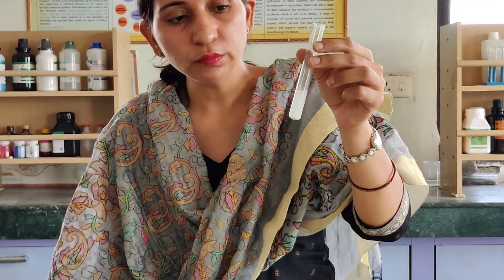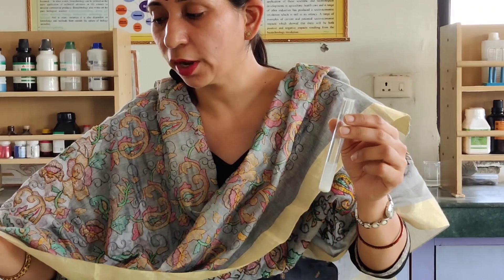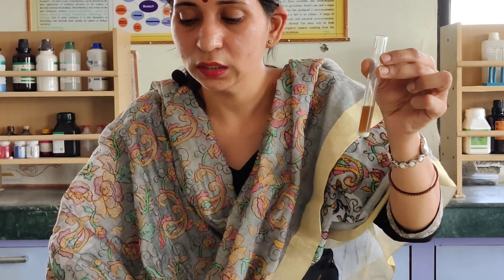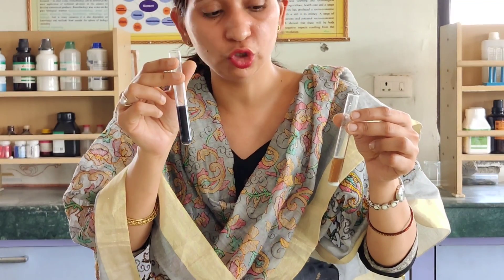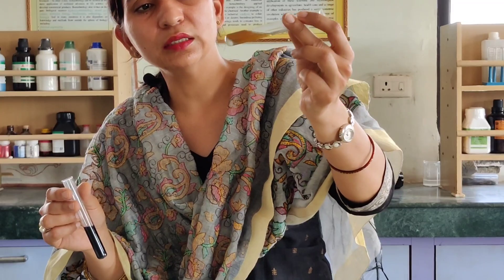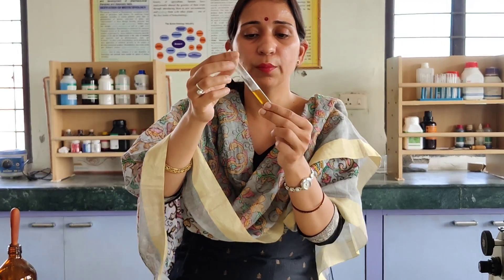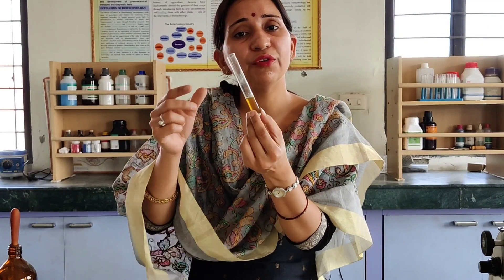After some time, we add a few drops of iodine solution to check for the presence of starch. Let's compare the results — the blue-black color is not present here. In the previous tube where salivary amylase was not added, we got the blue-black color with iodine. But in this test tube where salivary amylase was added, the starch has been broken down, so the iodine solution does not show the blue-black color. This confirms the activity of salivary amylase on starch.